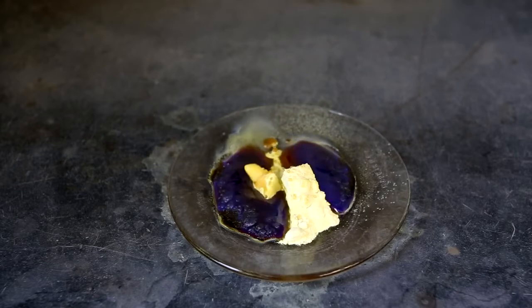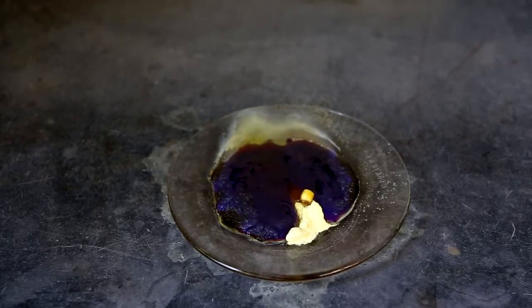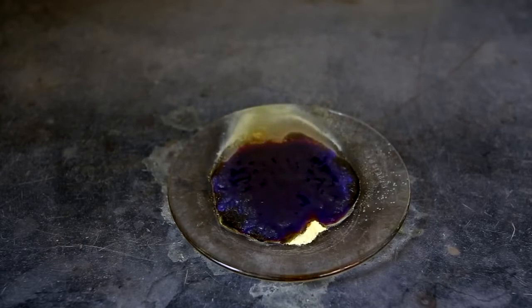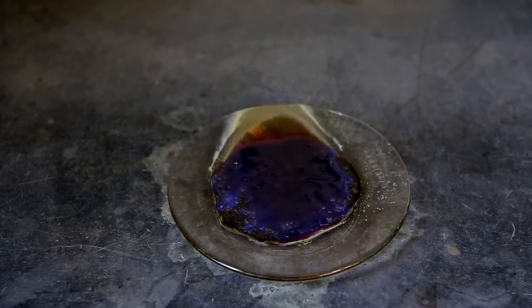The real-time version of the sulfur burning is going to be included immediately after this. It will be from the very start until it completely liquefies. I'll include some nice soothing background music.